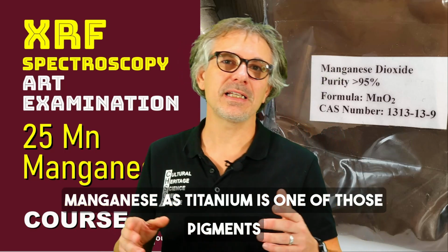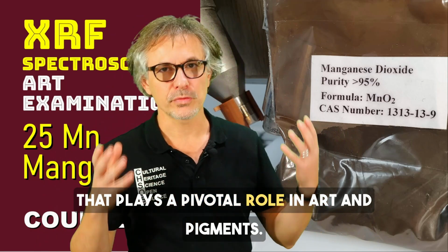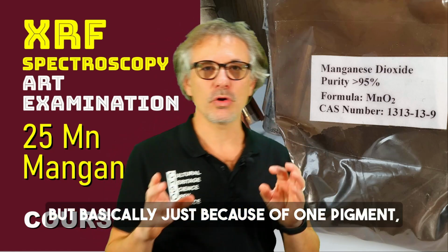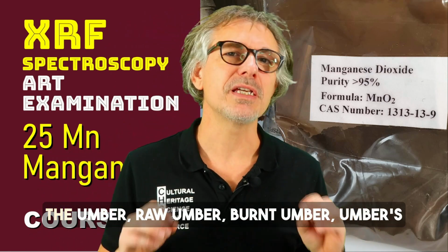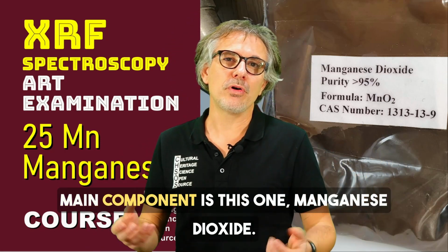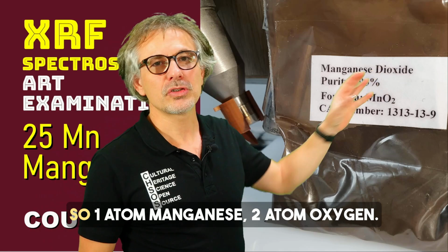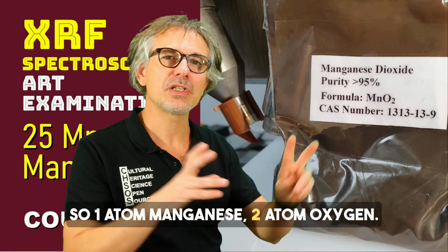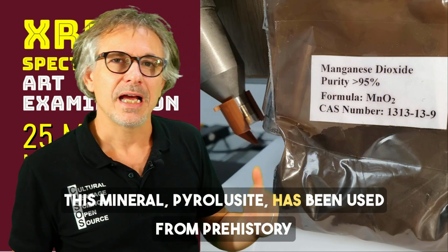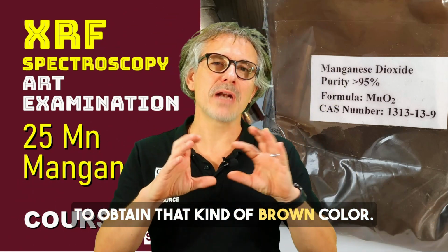Manganese, like titanium, is one of those elements that plays a pivotal role in art and pigments, basically because of one pigment, the umber. Raw umber, burnt umber. The main component of umber is manganese dioxide: one atom of manganese, two atoms of oxygen. This mineral, pyrolusite, has been used since prehistory to obtain that kind of brown color.